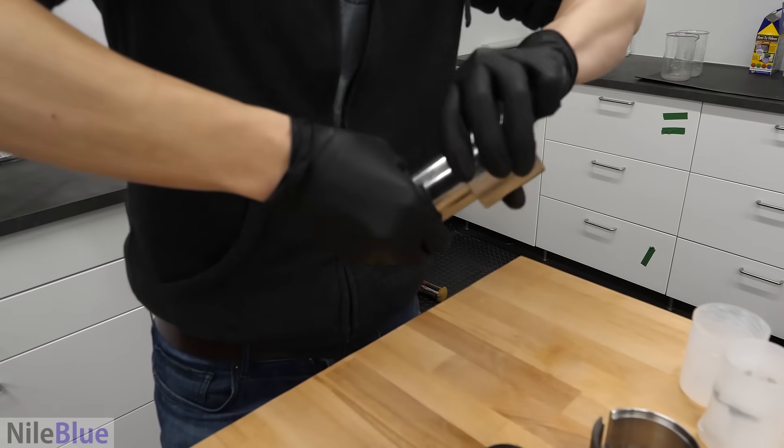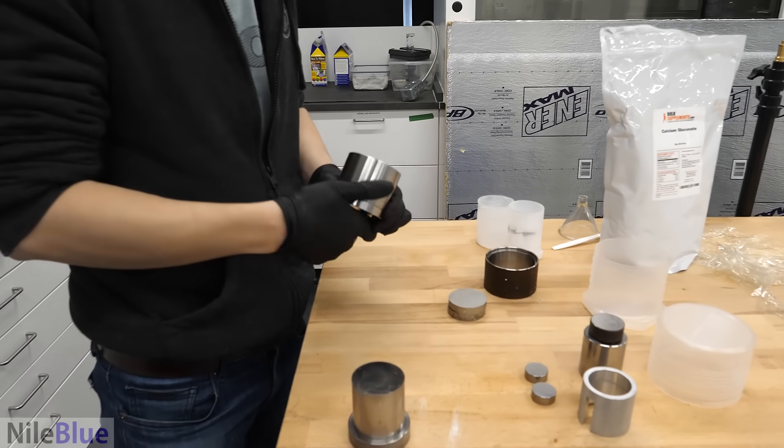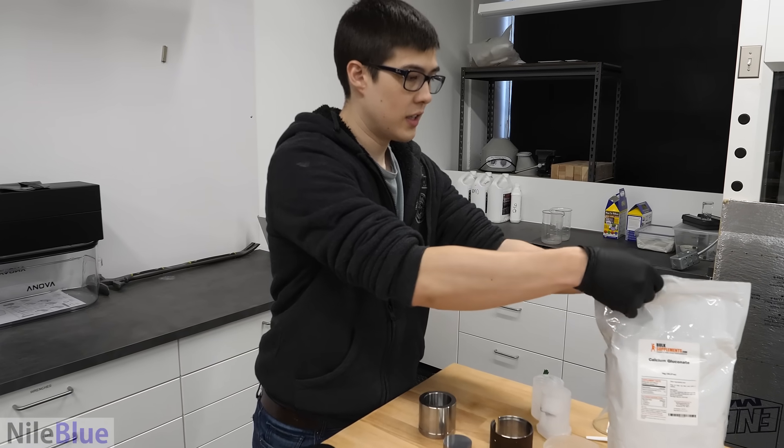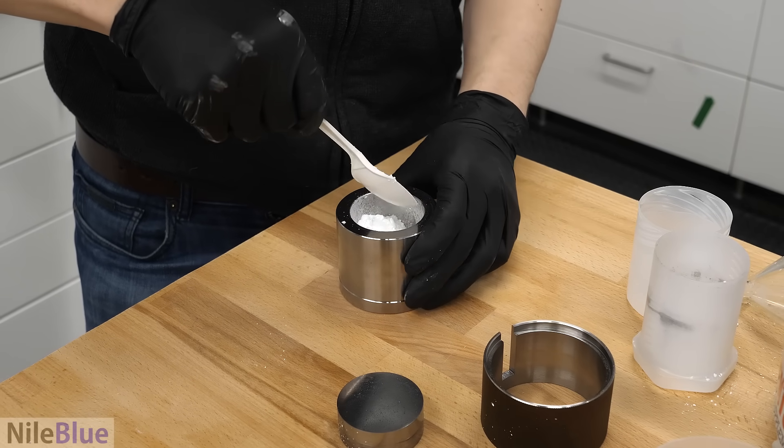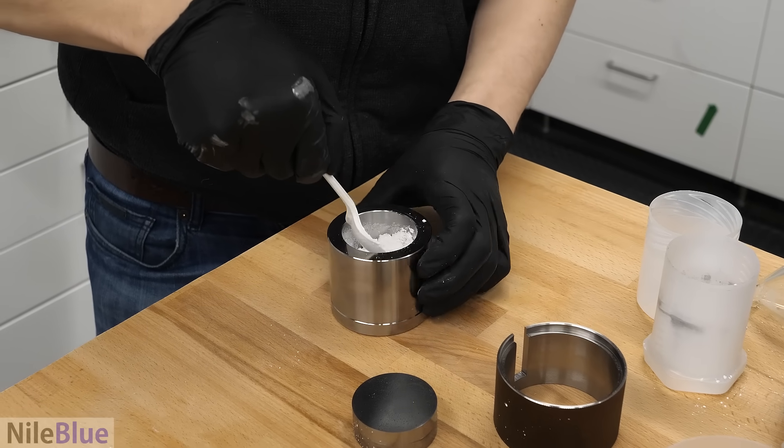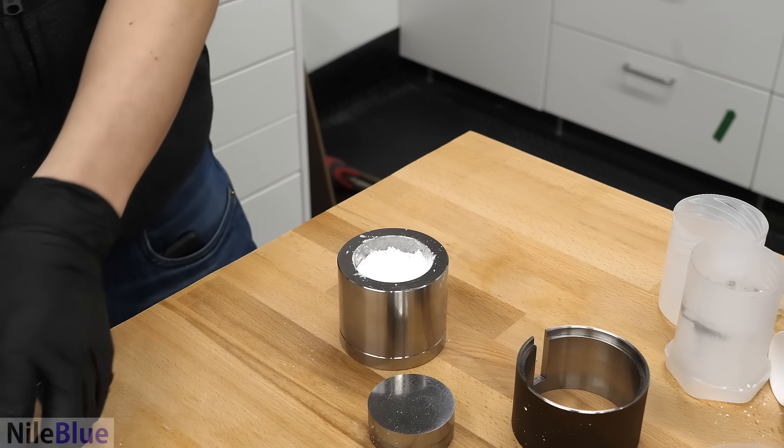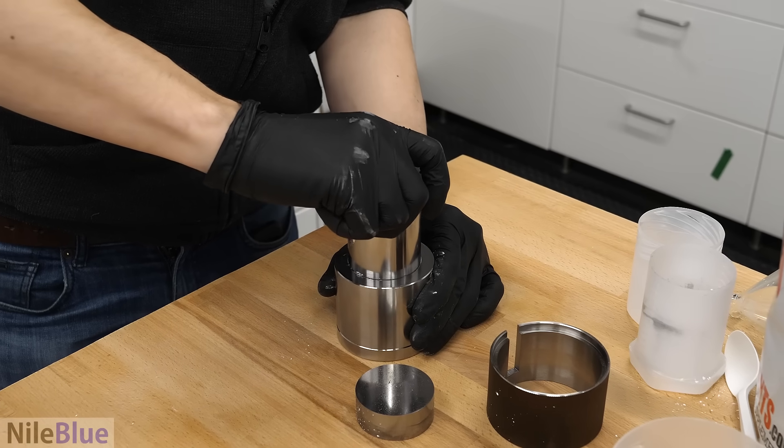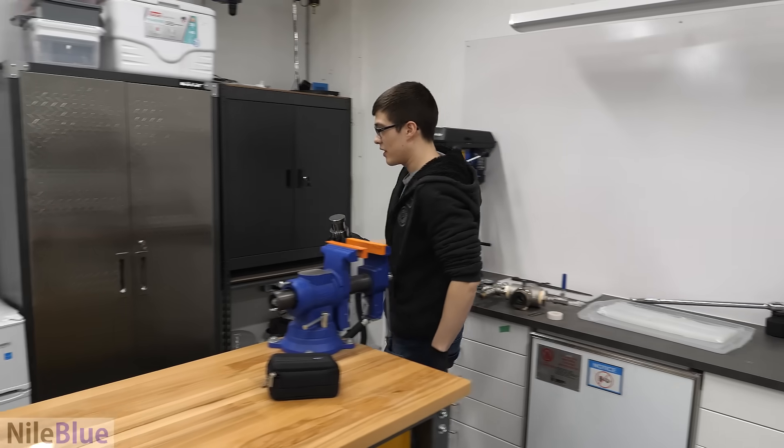It gets jammed so easily. Okay. Just to lubricate it, but whatever. Okay, so we're gonna add a bunch of it. It's kind of wet. I don't know what that means. I think this is good enough. Now to put the plunger part.